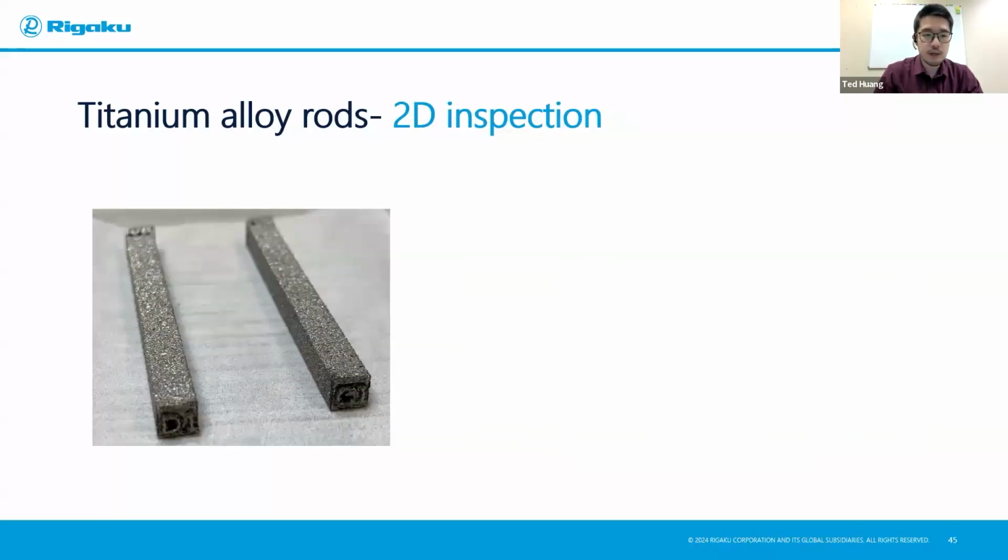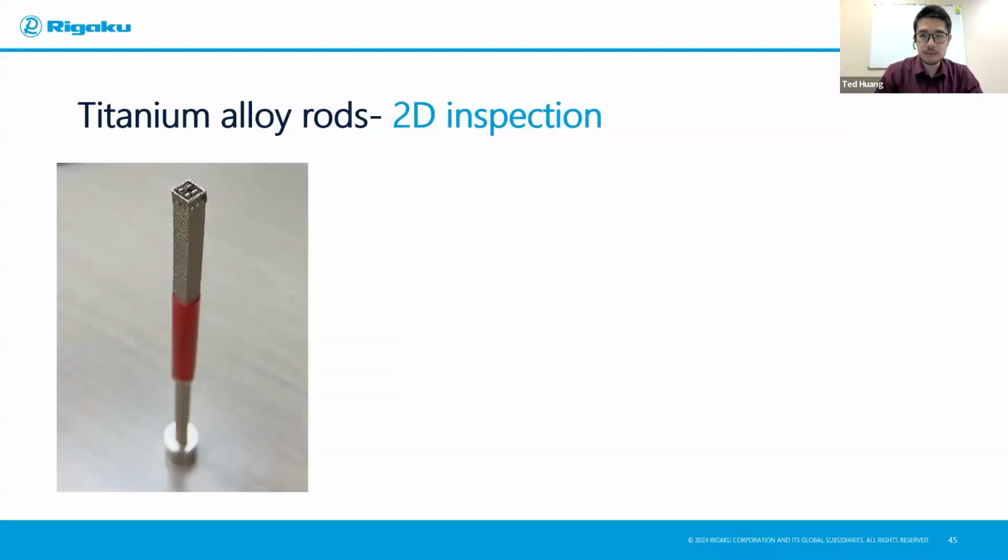So here are the two rods. You can even see the labels on them. One is D1, one is C1 for the different printing parameters. So this is how I mount them. This is also a benefit for CT comparing to many other techniques. It's really easy to image. There's not much sample preparation. I just mount it in a straw and then put it in there and then you can scan it. You don't have to worry about vacuum or anything else.